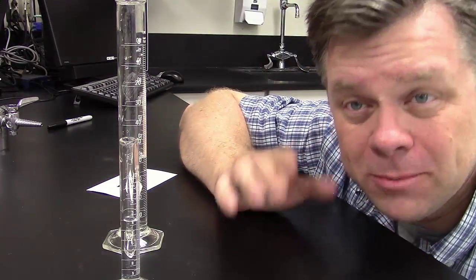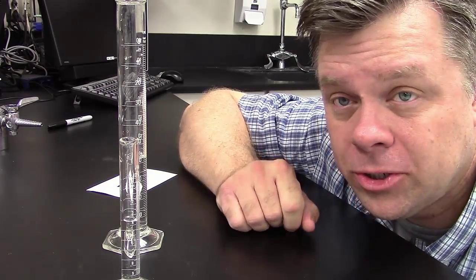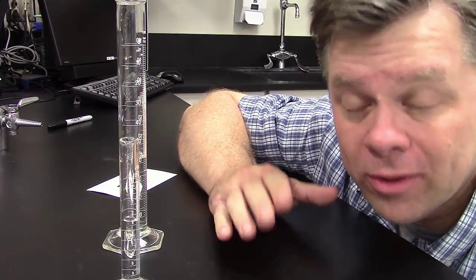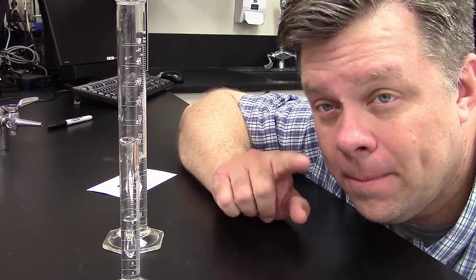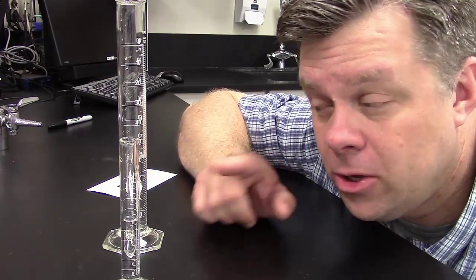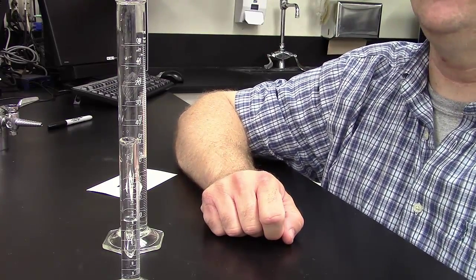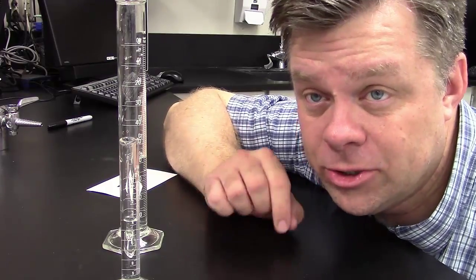But the real reason is I'm trying to illustrate the point that once you've decided that you're going to measure a liquid with a graduated cylinder, you have to be sure you know how to do it the correct way. For instance, the biggest measurement errors that people make with graduated cylinders is they're trying to do it up here, and they say, oh, I can read it. But in actuality, you have to understand how the graduated cylinder is designed.